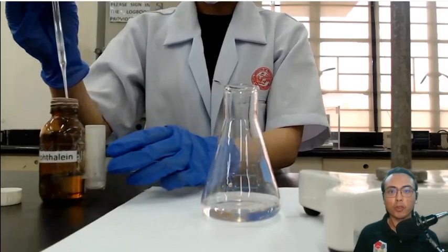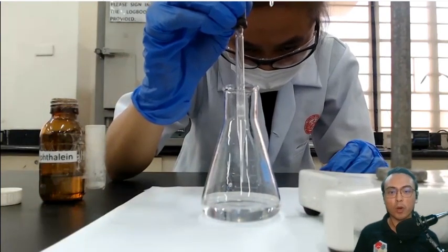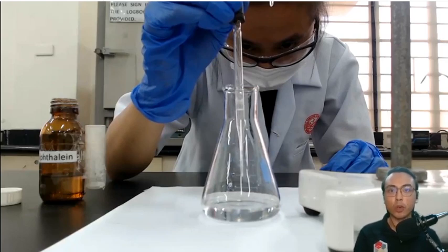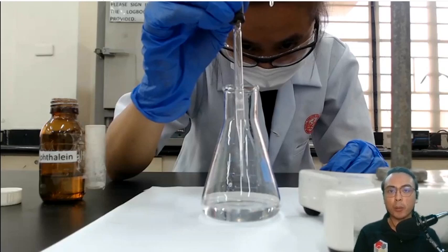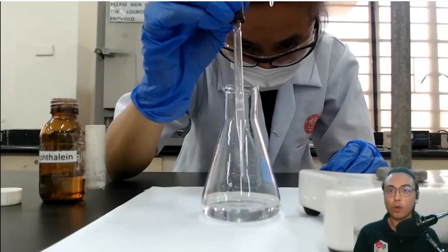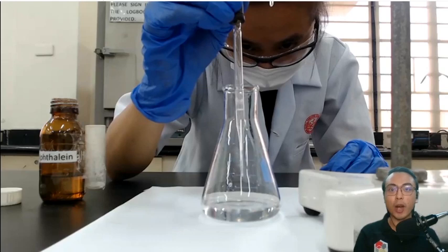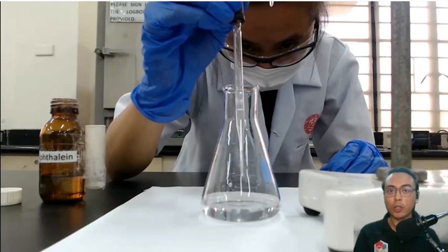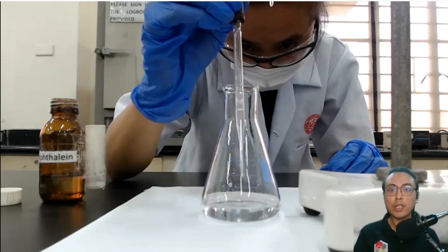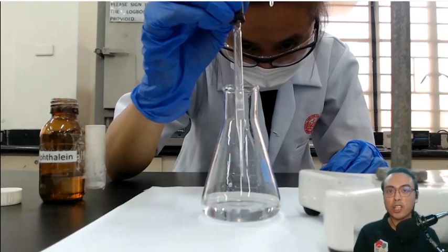Now comes a very important part: she is adding a few drops of the phenolphthalein indicator to the Erlenmeyer flask. At this point you now have three components in your flask — your vinegar sample, distilled water, and the phenolphthalein indicator. The purpose of the phenolphthalein indicator is to tell you when the titration is over. Under acidic conditions phenolphthalein is colorless, and under basic conditions it is bright pink. Since you only have distilled water and acetic acid in the flask, the phenolphthalein is still colorless.